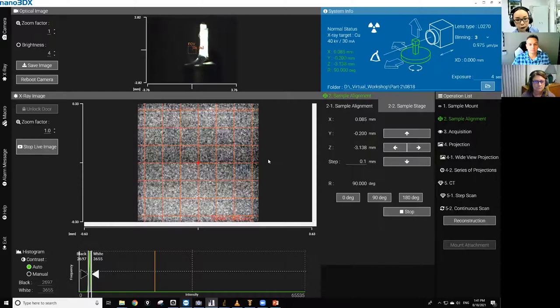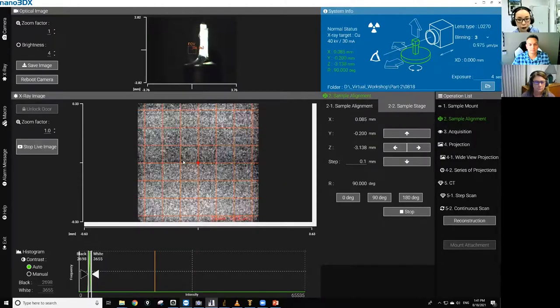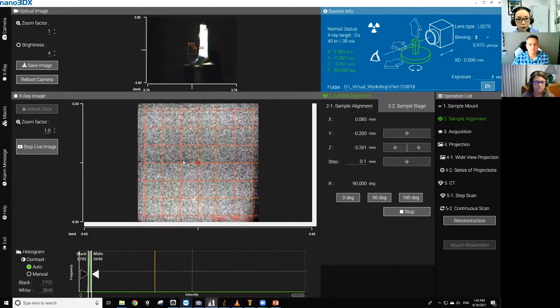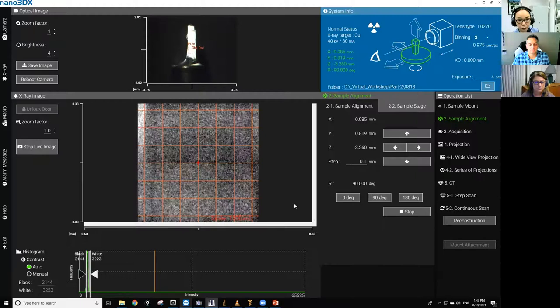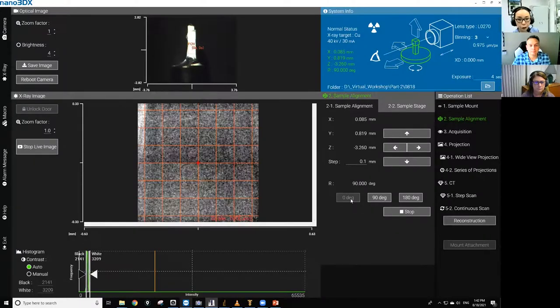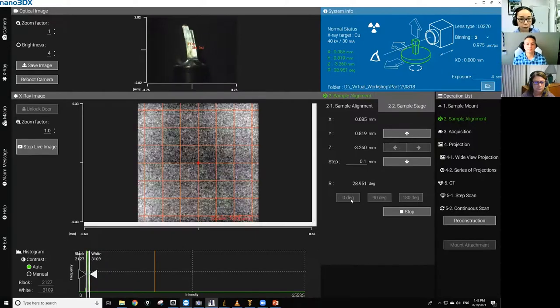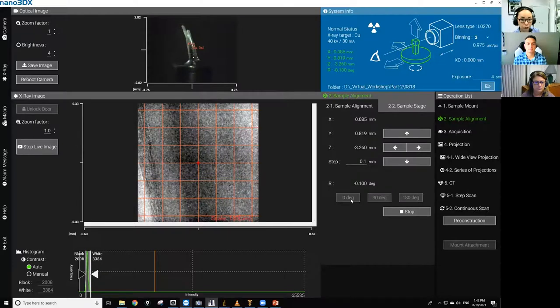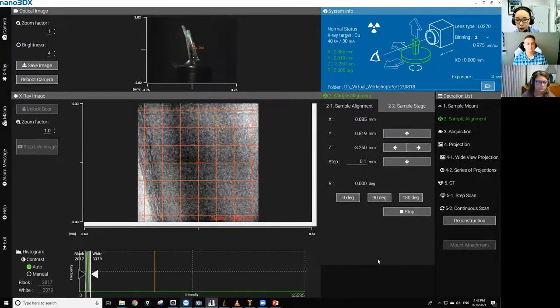Okay, that's way off. Okay, that's pretty much centered. So go back to zero. Okay, so this looks good. So let's do a scan.